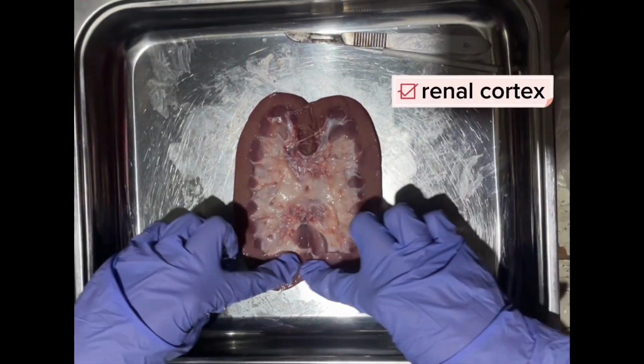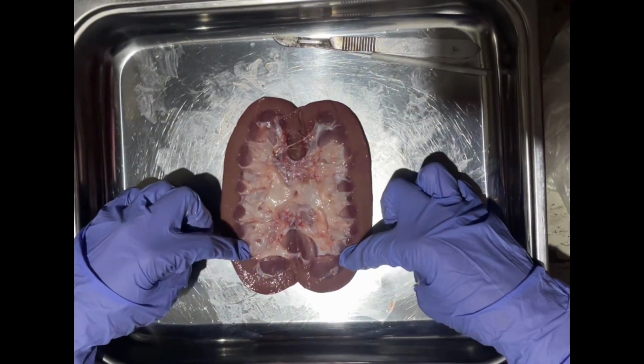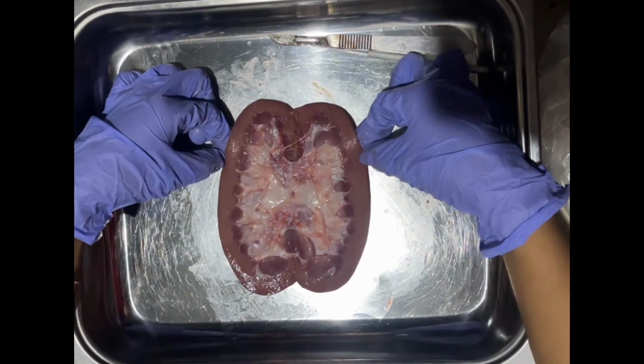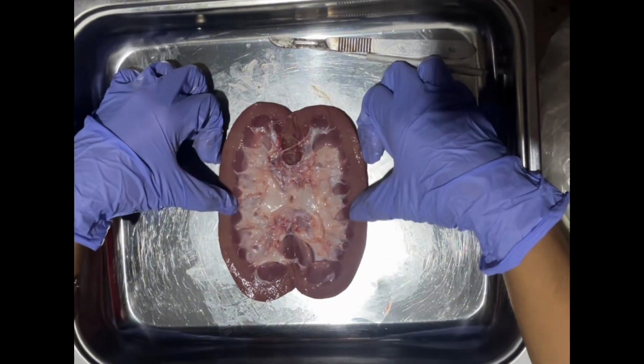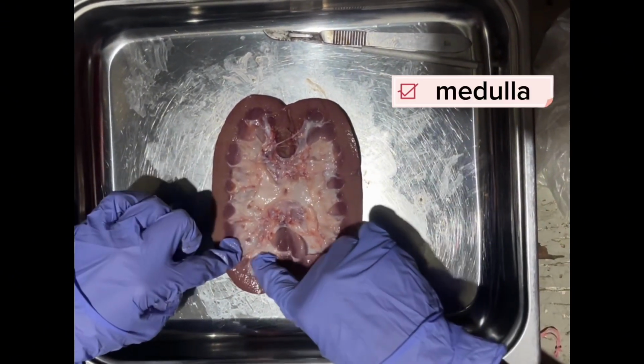This is the renal cortex. It is the solid-looking outermost part of the kidney. It contains many small arteries and veins that carry blood to and from approximately 1 million nephrons located in the cortex. And this is the medulla.